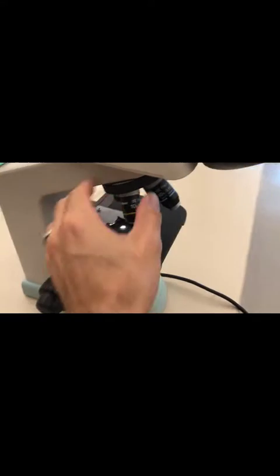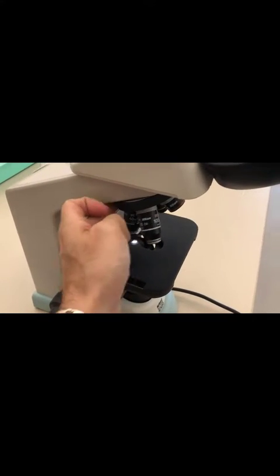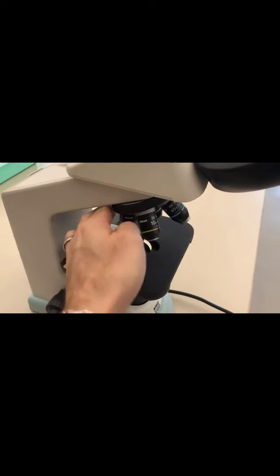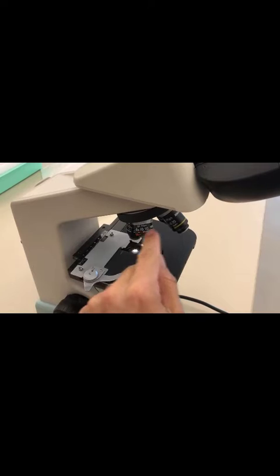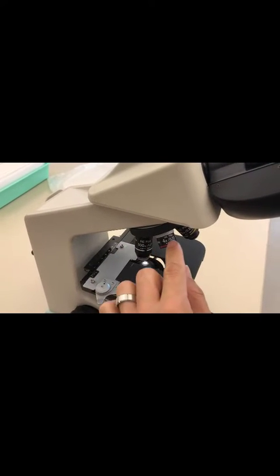Also notice these. These are objective lenses. Each one magnifies the sample and they rotate around. This is the 4x or scanner objective lens, the 10x or low power, 40x high power, and the 100x oil immersion lens.